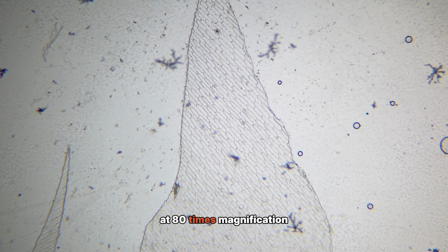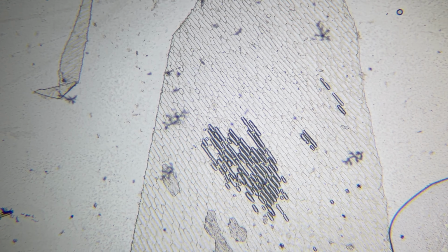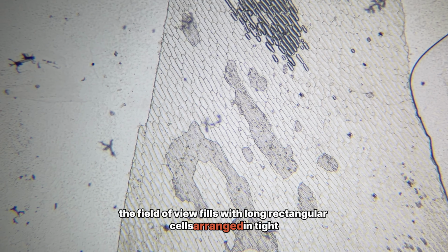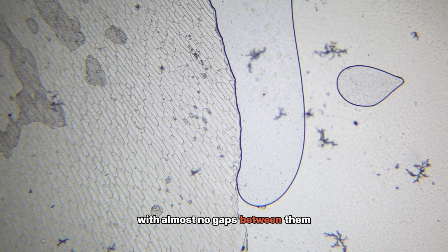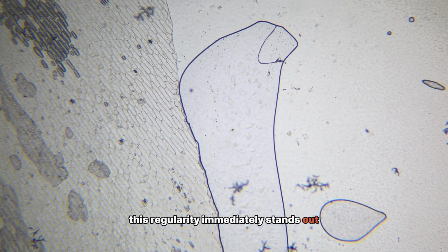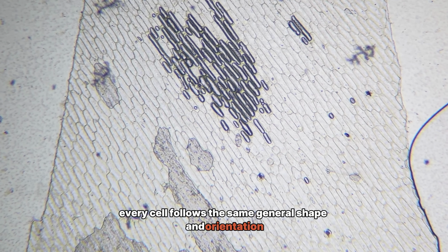At 80 times magnification, the onion reveals a structure that feels unexpectedly precise. The field of view fills with long, rectangular cells arranged in tight, repeating rows. They resemble bricks in a wall, aligned side by side with almost no gaps between them. This regularity immediately stands out. Nothing looks random. Every cell follows the same general shape and orientation.